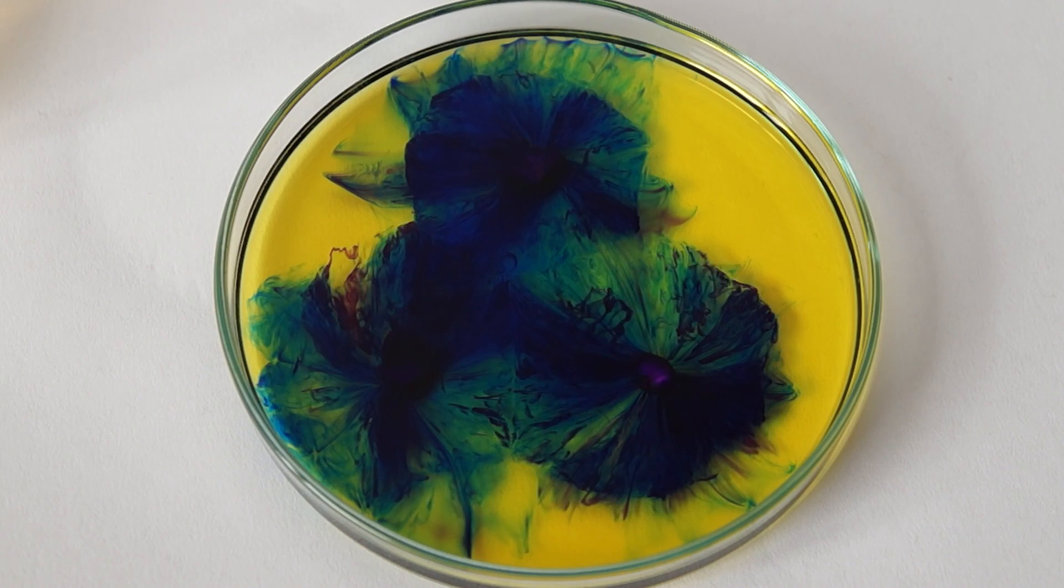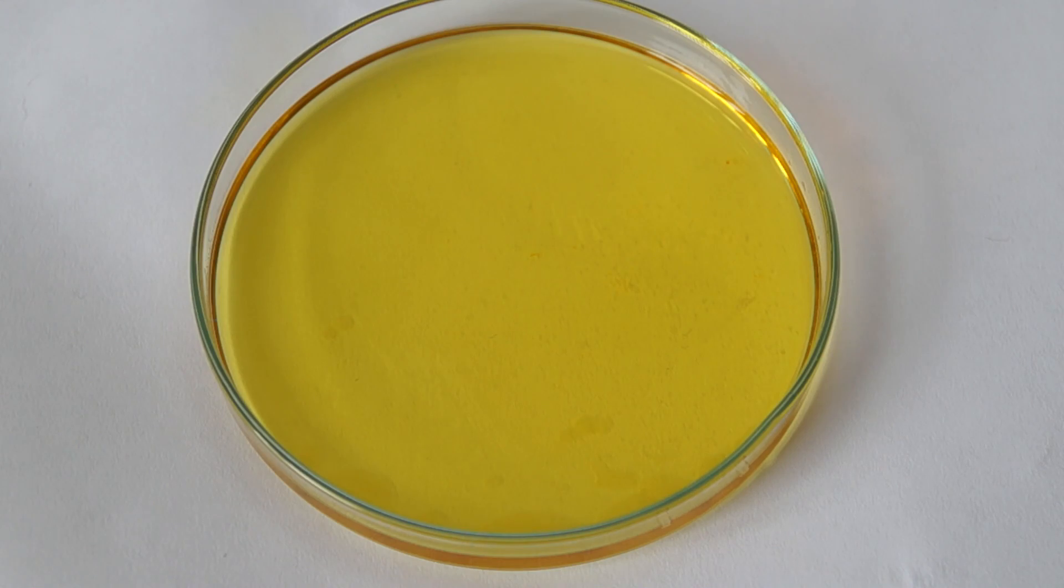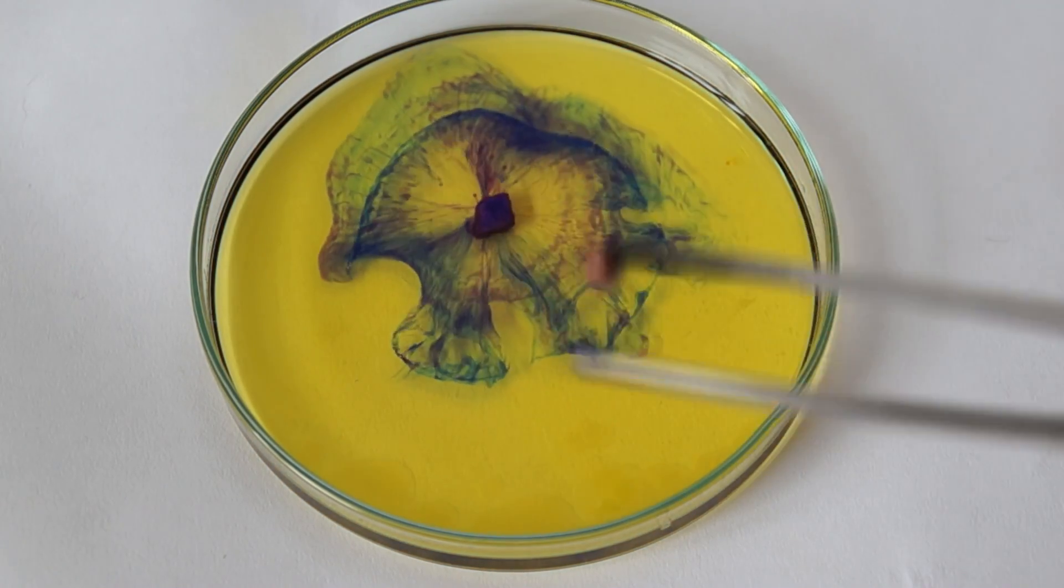I have conducted this experiment several times with slightly varying proportions of ethanol and isopropanol. Here we have added more ethanol.